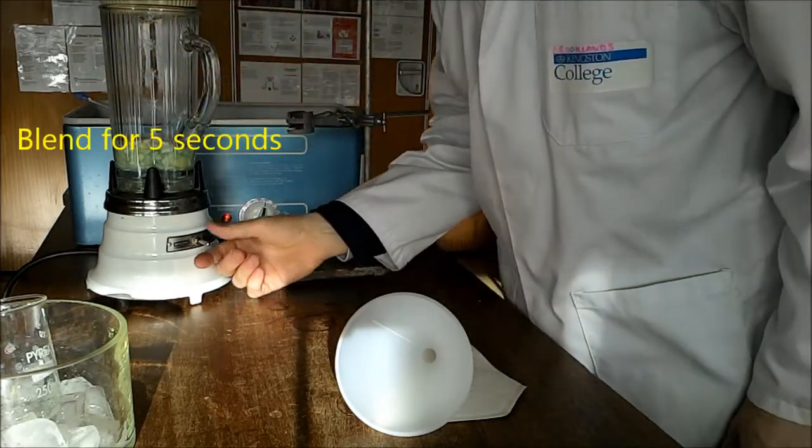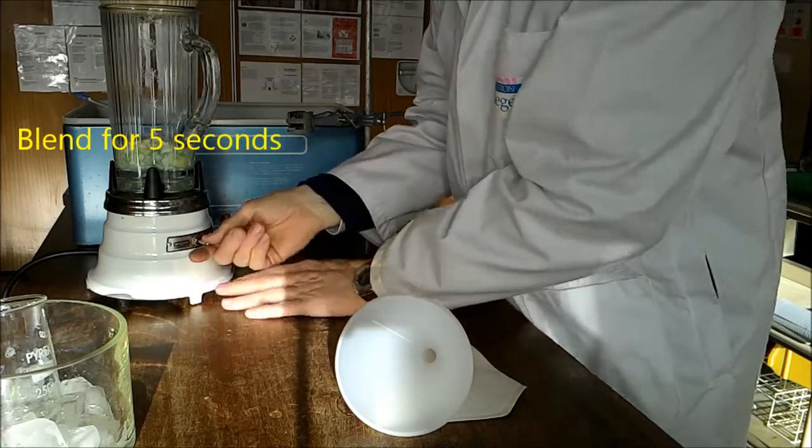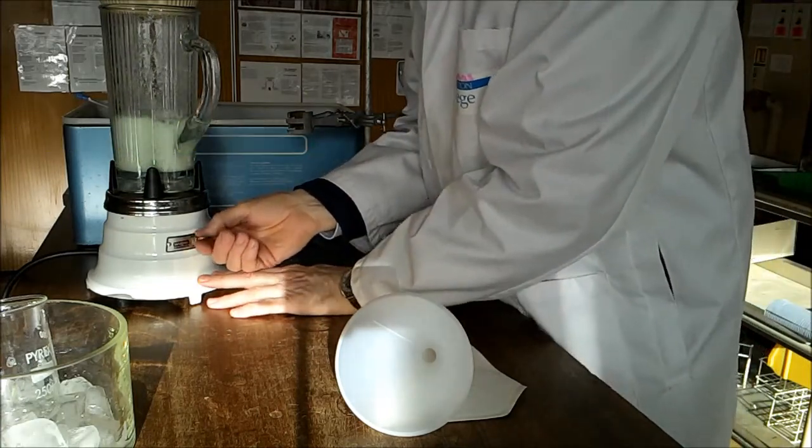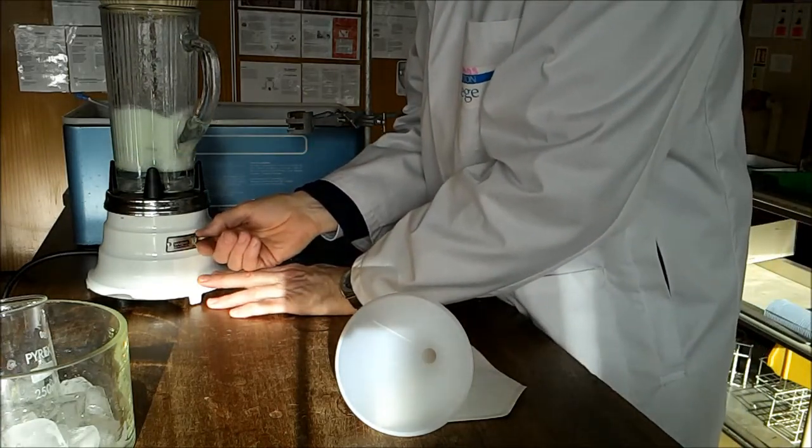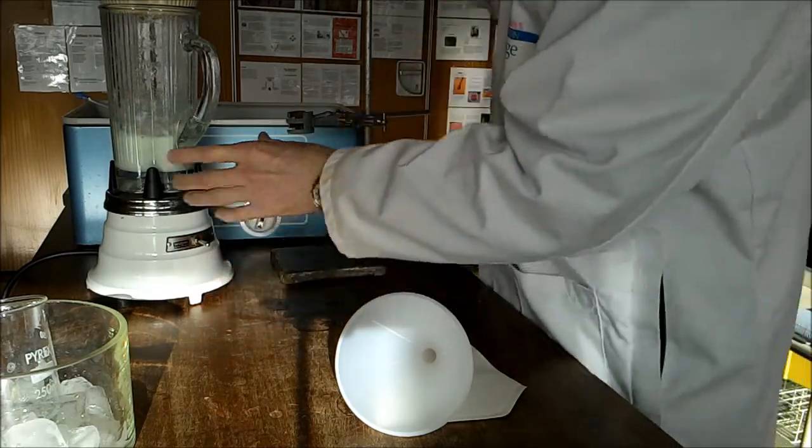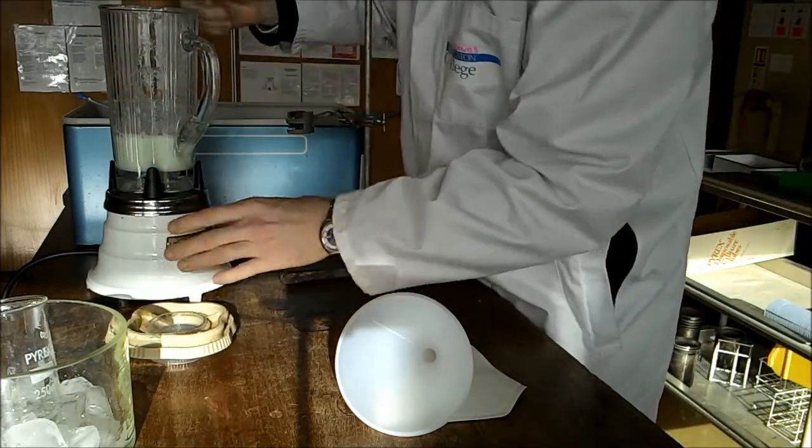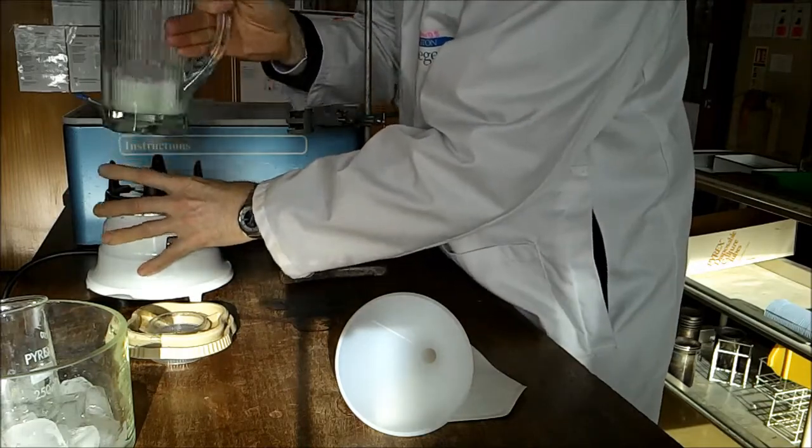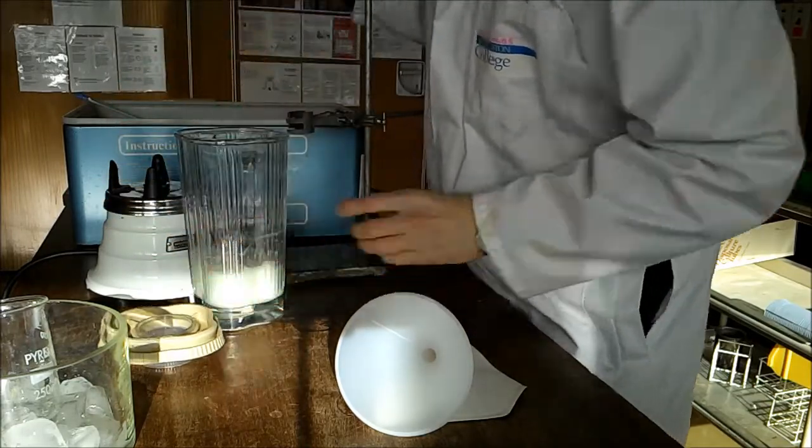We blend this for 5 seconds: 1, 2, 3, 4, 5. A short time so we don't damage the DNA.